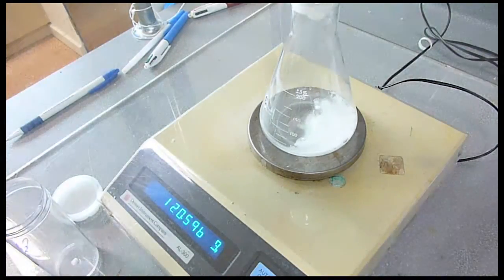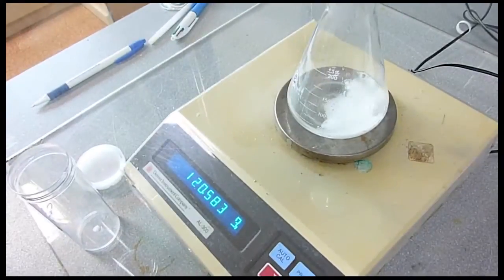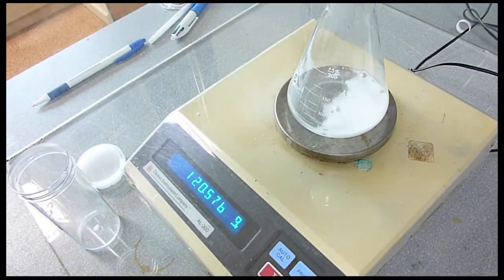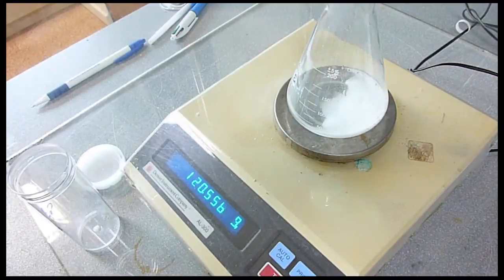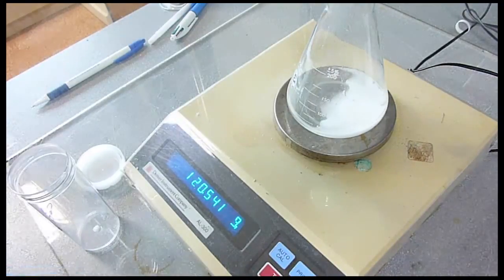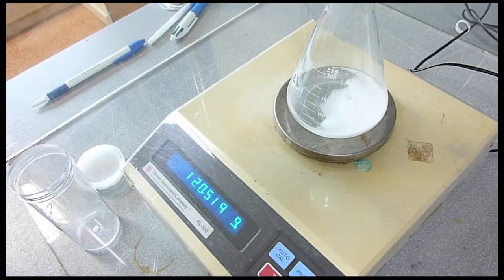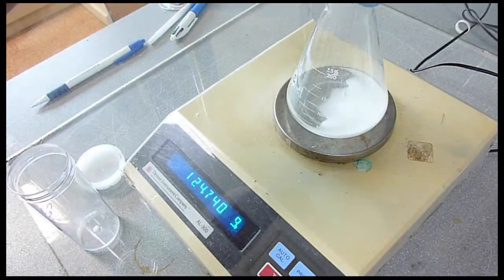Okay, hopefully we can see some bubbling going on there and the mass seems to be decreasing. We could measure the decrease in mass over time to calculate a rate of reaction. I'm just going to give this a bit of a swirl.